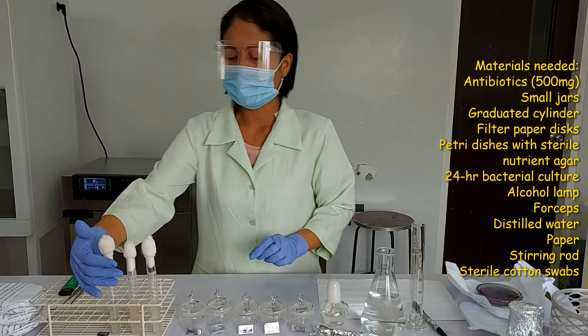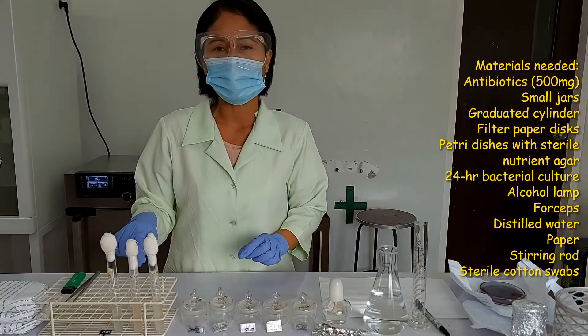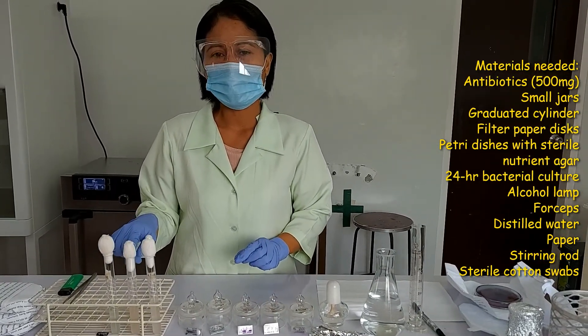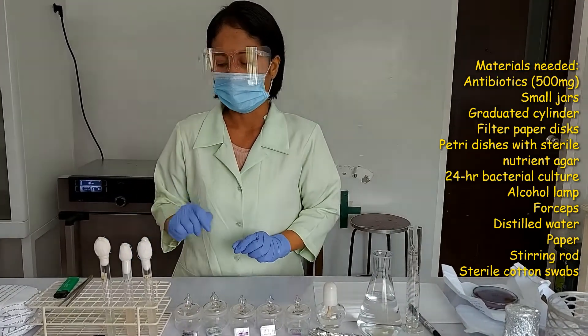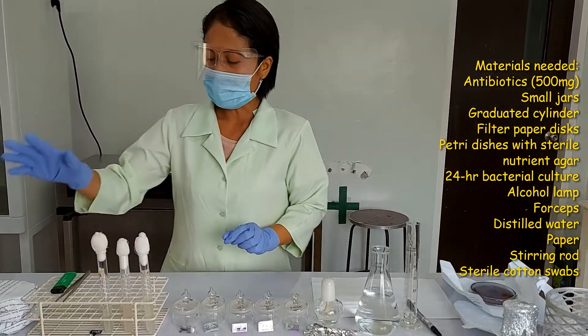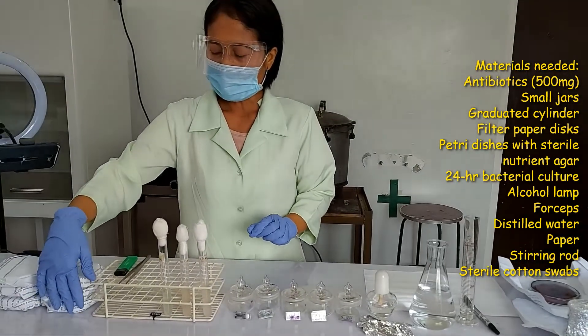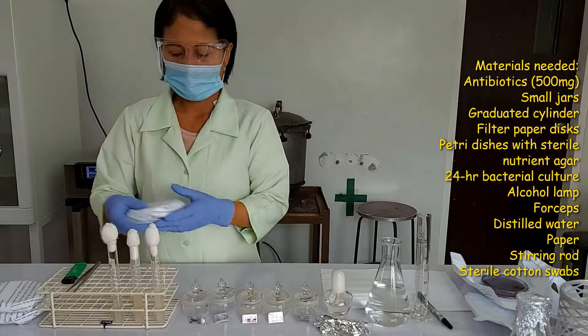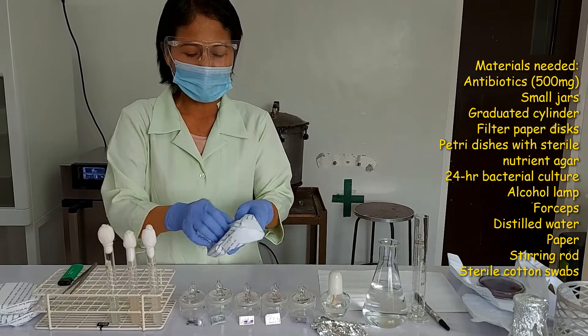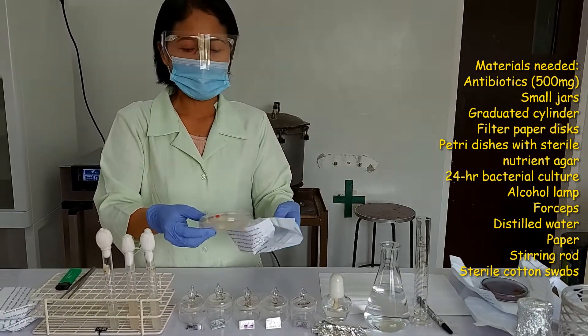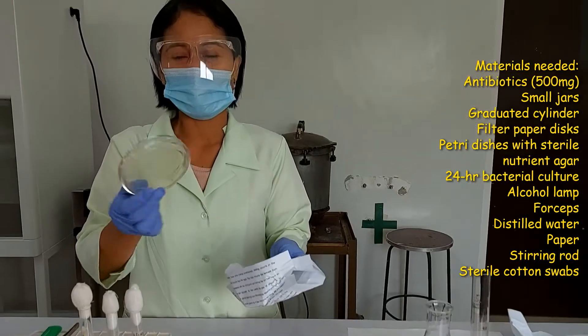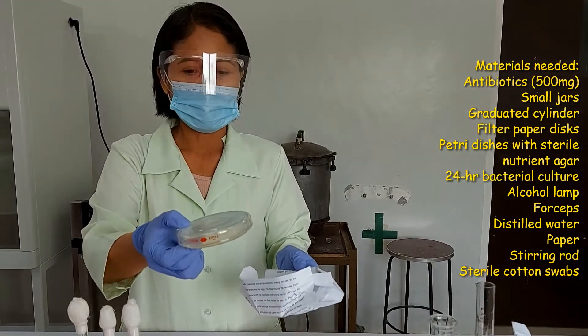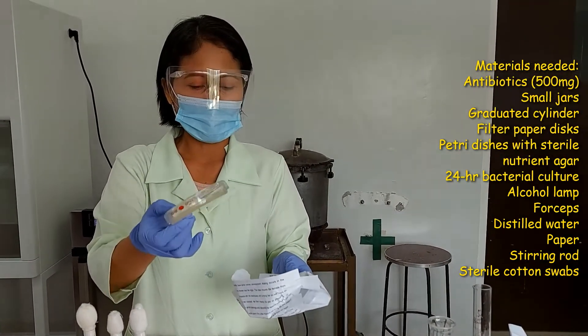And these 3 test tubes in here are 24-hour subculture of unknown bacteria. And I have here petri dishes with solidified agar that is previously sterilized. So this is a sterilized nutrient agar that is already solid.